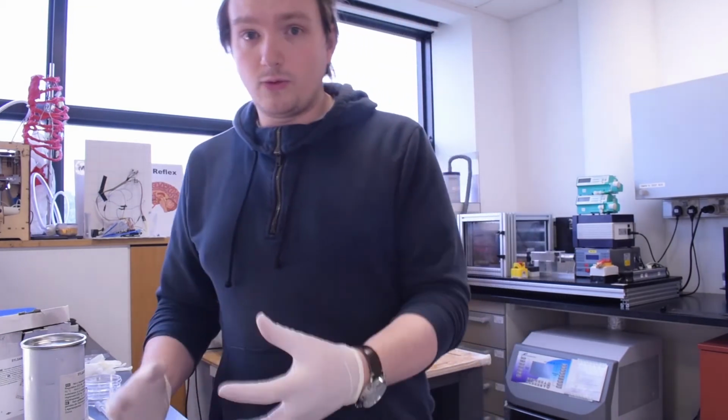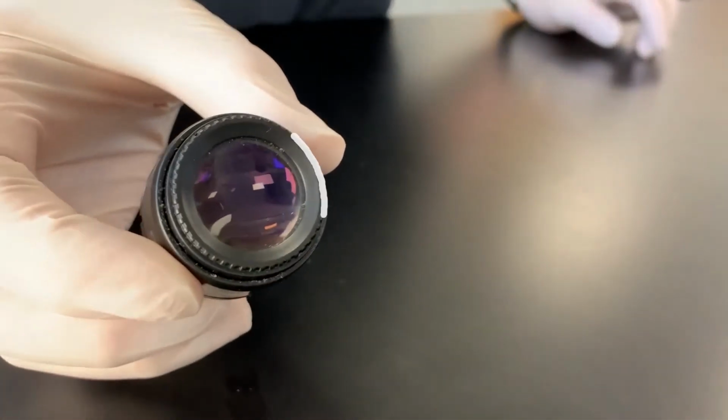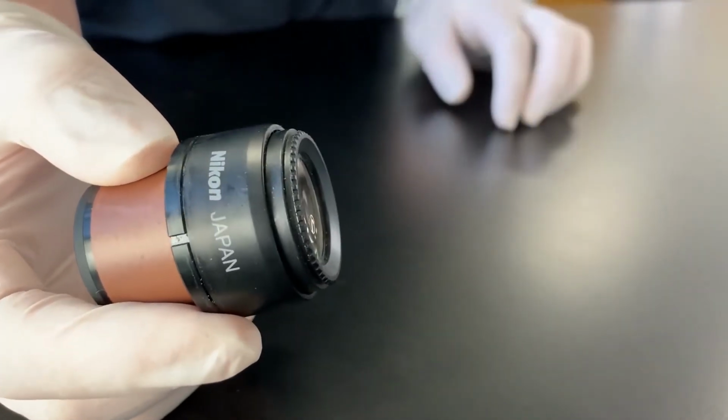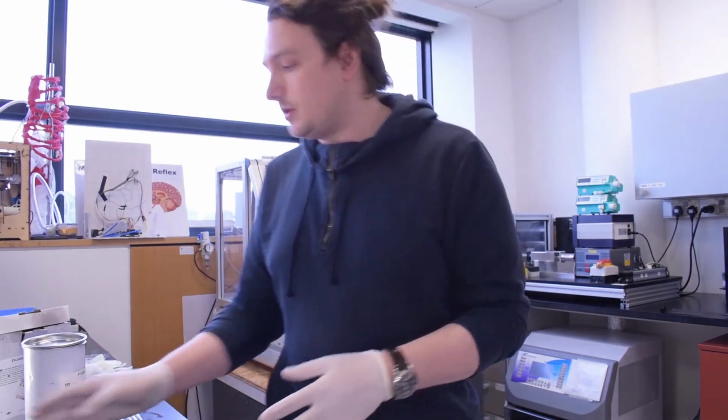So microscopes don't have to be the big, fancy, expensive looking things that you see on TV. They can be really cheap. The only thing you need for a microscope is a lens. A lens is just a curved surface made of a transparent material that is used to bend the light in a way that it normally wouldn't go. What this does is it means that the things that are close up to the lens appear bigger on the other side of the lens. That just makes it look bigger.